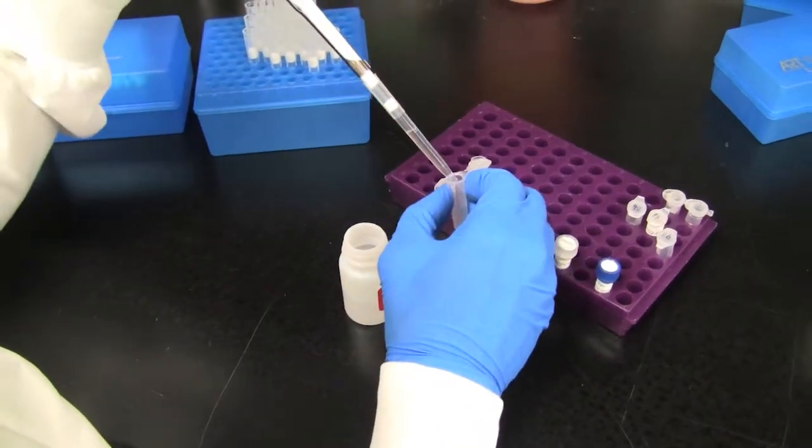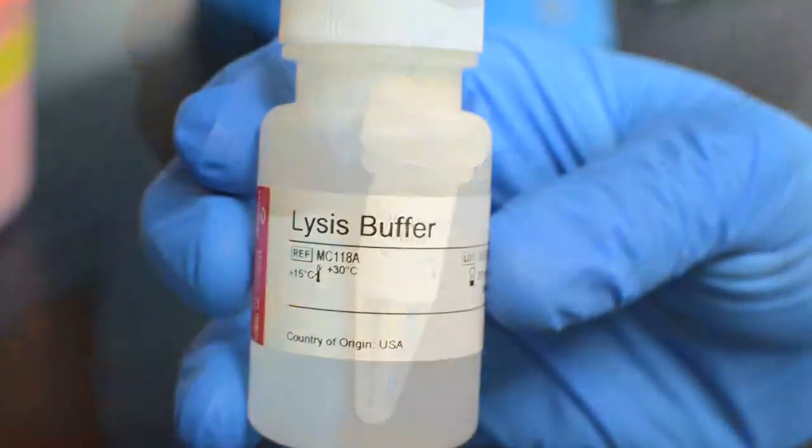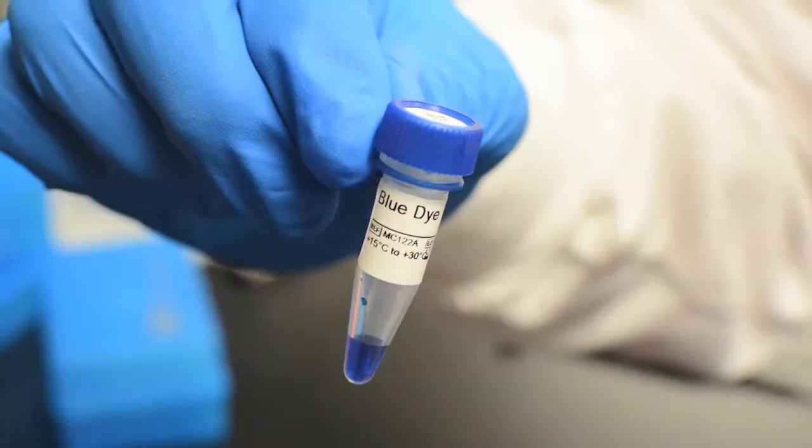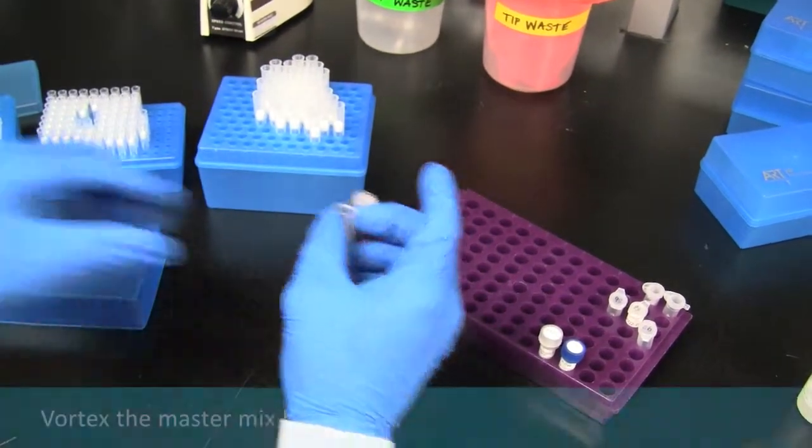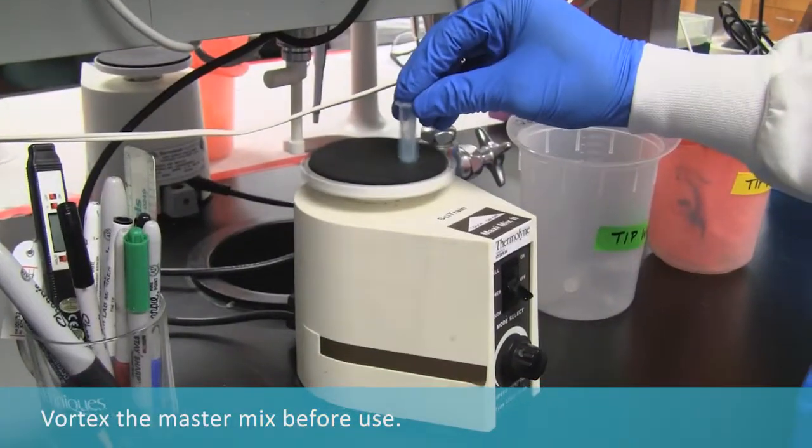Prepare a master mix consisting of buffer, proteinase K, and an inert blue dye. The formulation is in the technical manual. This master mix must be made fresh for every procedure.